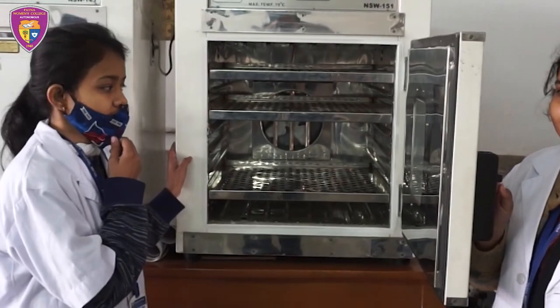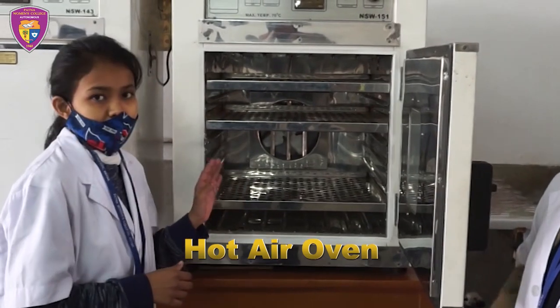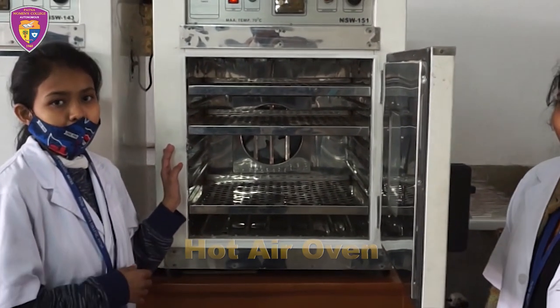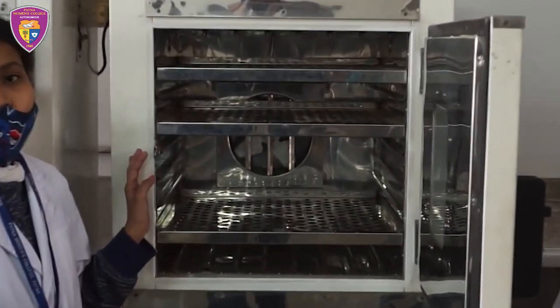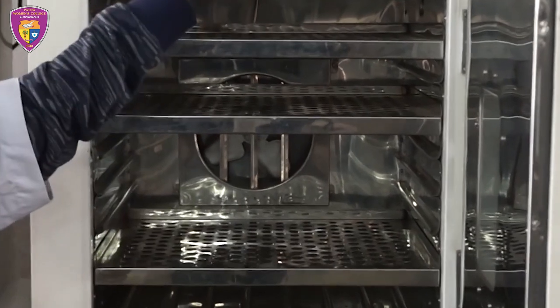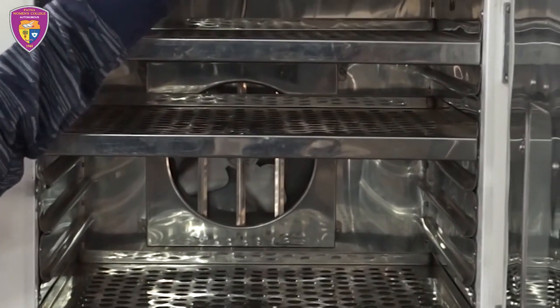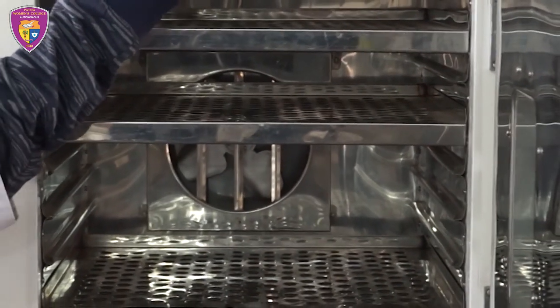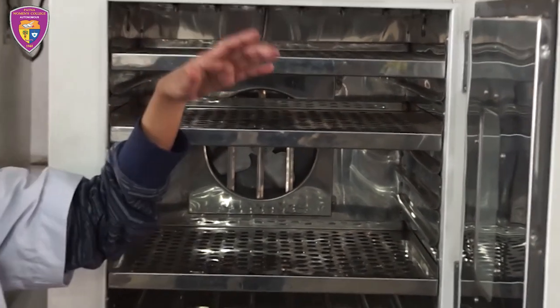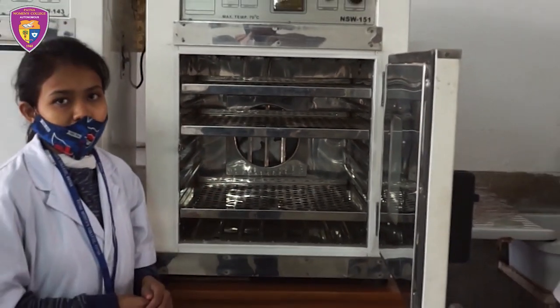The incubator has an electrically heated chamber and a thermostat used to maintain the optimum temperature for the normal growth of cells. When the desired temperature is reached, the connection is automatically cut off.